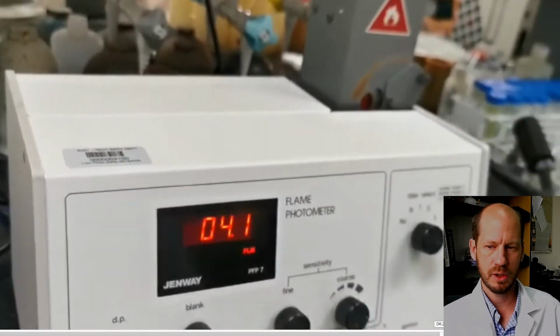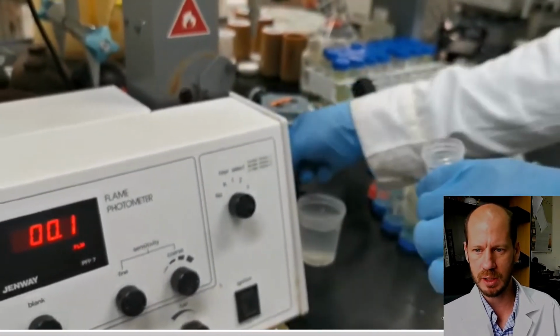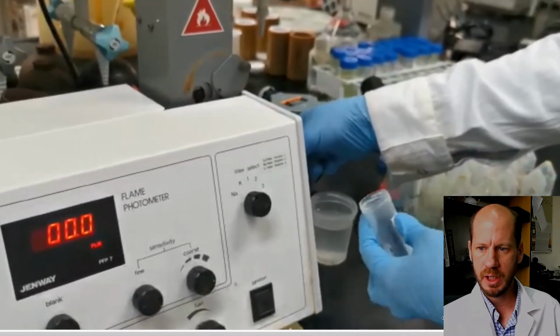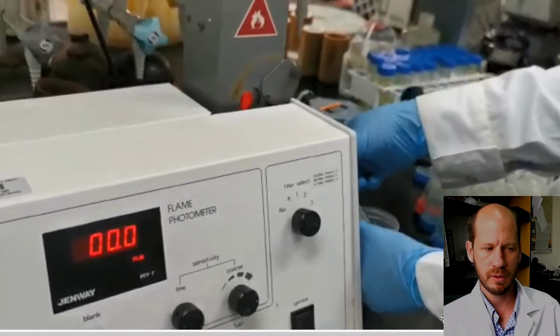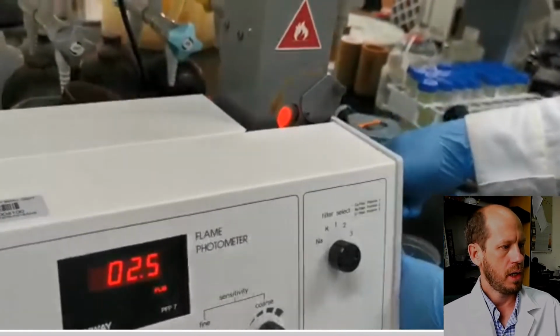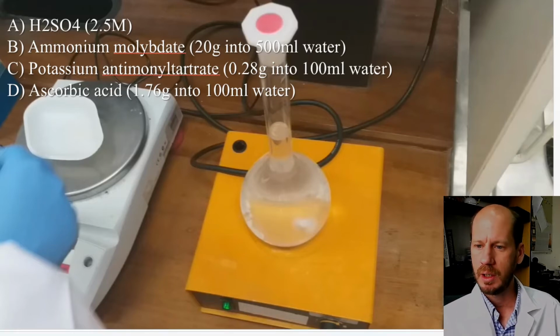And the concentration, of course, is of a diluted sample or filtrate. We have to dilute it 100 times for measuring in order to have a good range of concentration for the measurement. And for the measurement of the phosphorus concentration, we're going to use the same procedure that we had for soil extracts, also using the moly blue phosphorus.